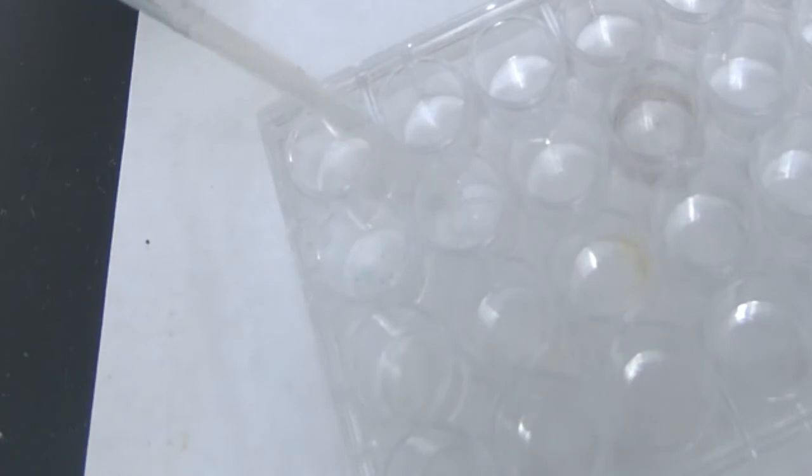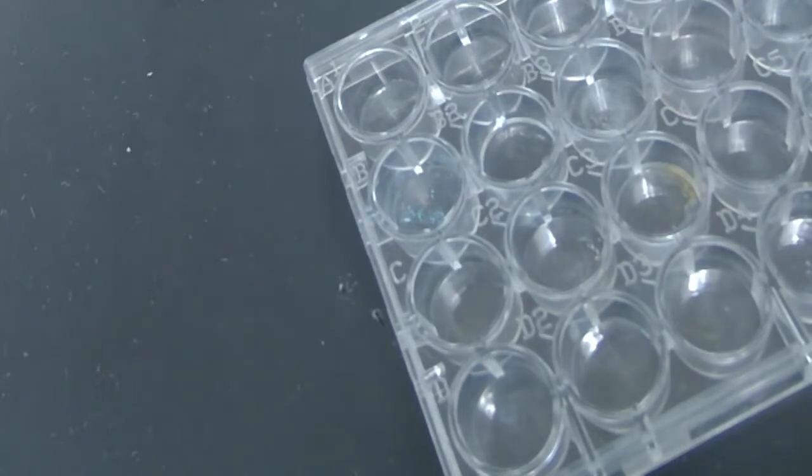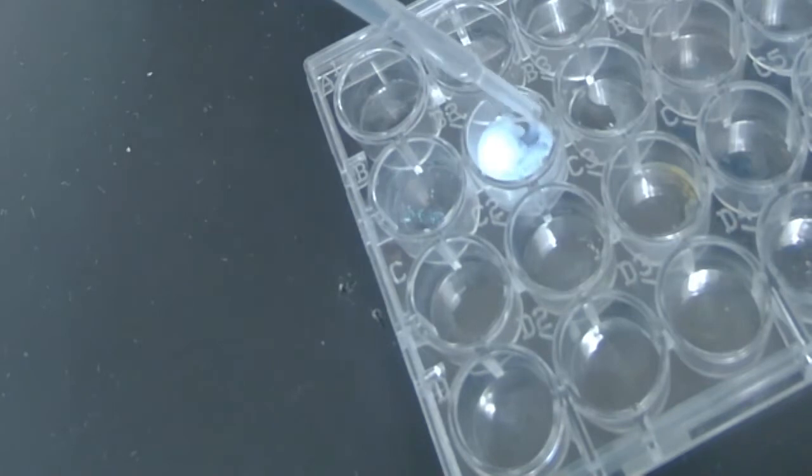Now it says stir with a toothpick, but I'm actually just going to use the pipette here. Just enough to cover my salt. So stir, stir, stir. Okay. And you know what? I think I'm going to get rid of this white background because there's a good chance we'll see our change here better if I don't have a white background. We'll see. Now I'm going to add silver nitrate, AgNO3. And I'm going to add a little bit of this. Whoops, wrong well. Ooh, nice. Okay, make your observations.